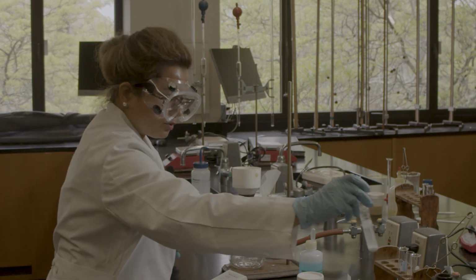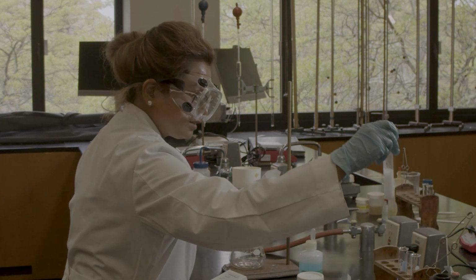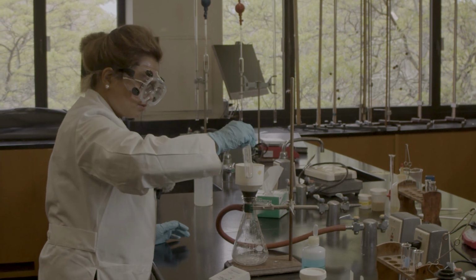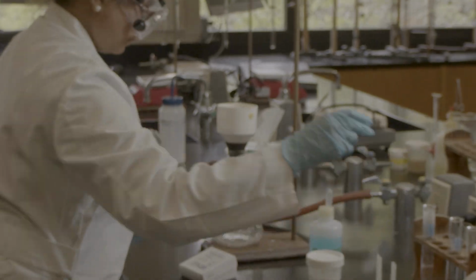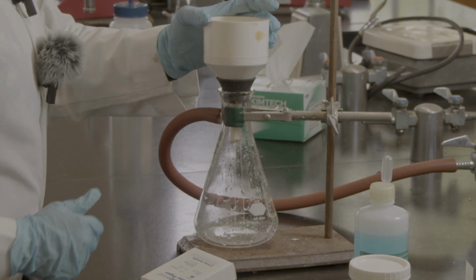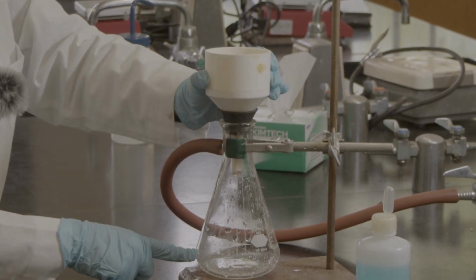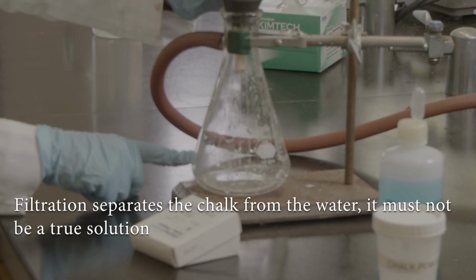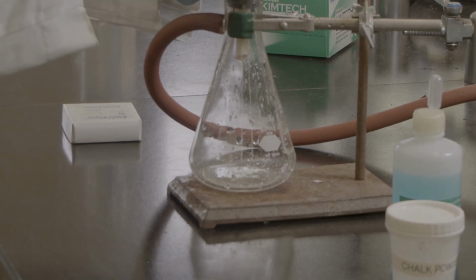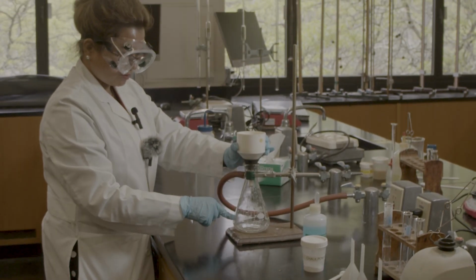I'm going to pour it. Before I pour it, I want to mix it up again so that my whole chalk powder goes inside. So now I'm pouring it. You can see that there is clear water, no chalk inside. Only the chalk powder is filtered using my filter paper.